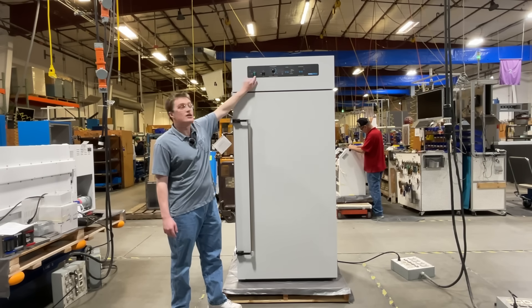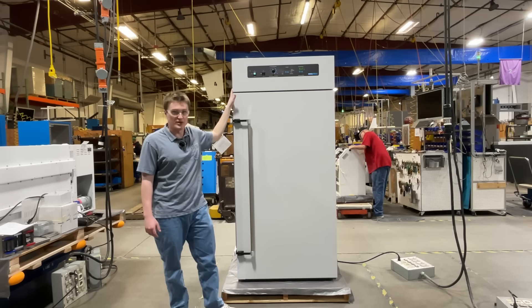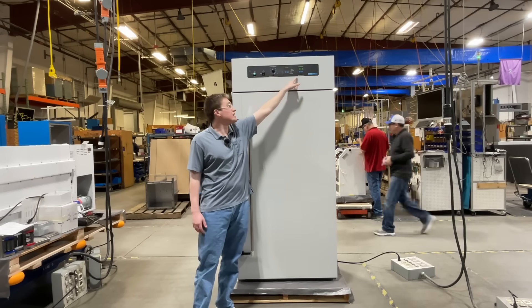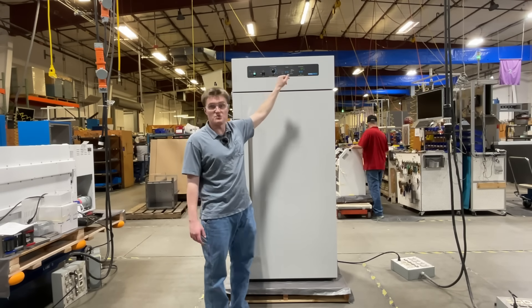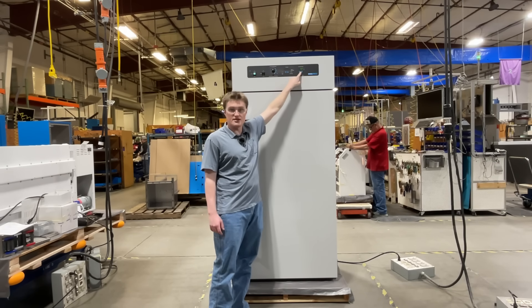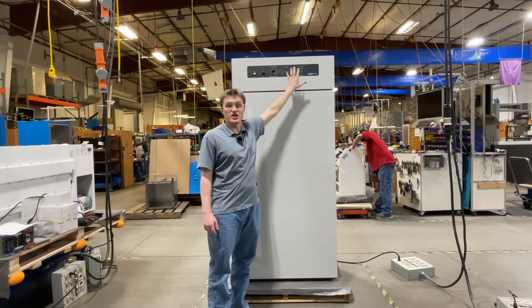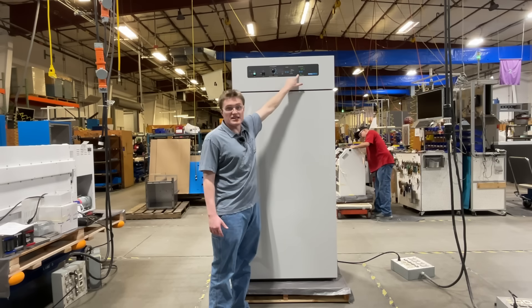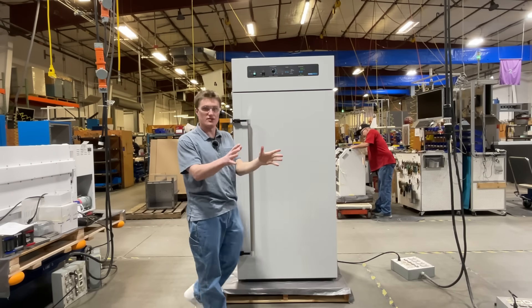On the far left, there is a lighted power switch. This is the main power for the unit. Once you hit this, the temperature display becomes active. After a few moments, it will display the current temperature inside the chamber — this is 32 Celsius. The up and down arrows allow the user to adjust the temperature setpoint on the fly. This heating-activated light, when on, means that power is being sent to the heating elements.